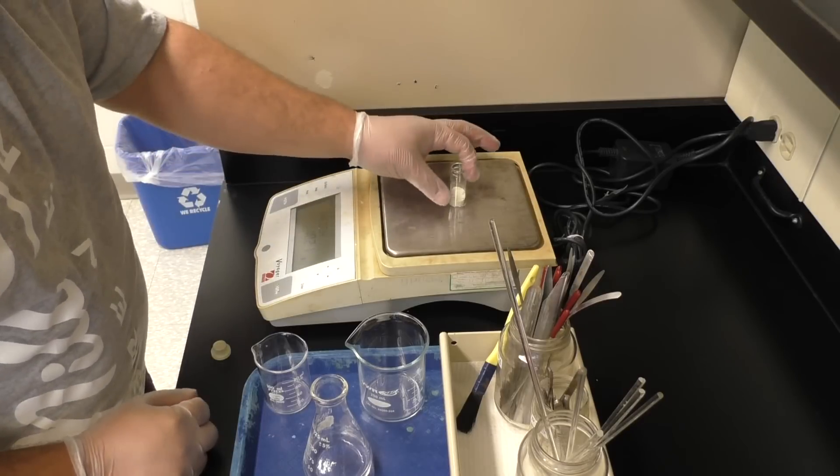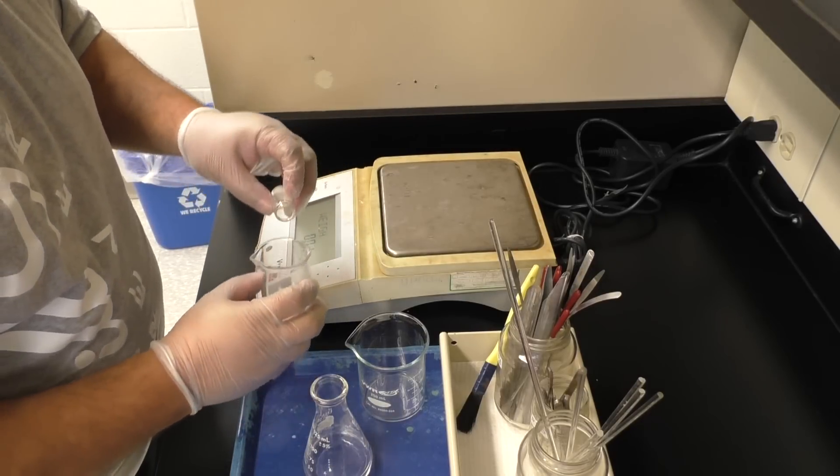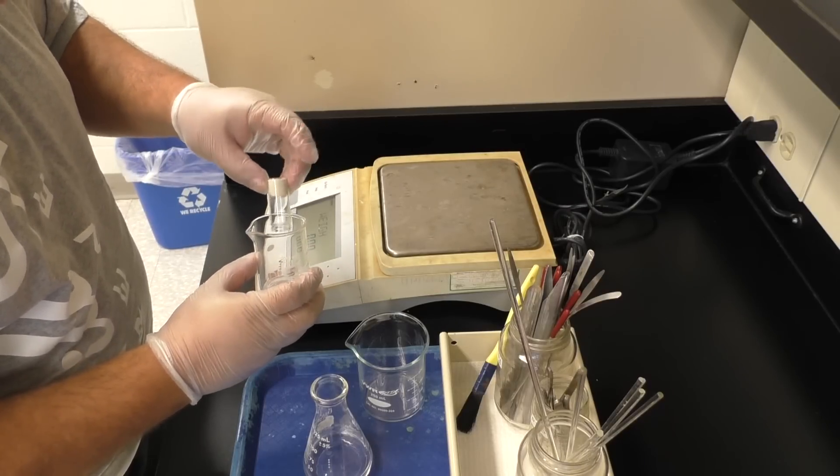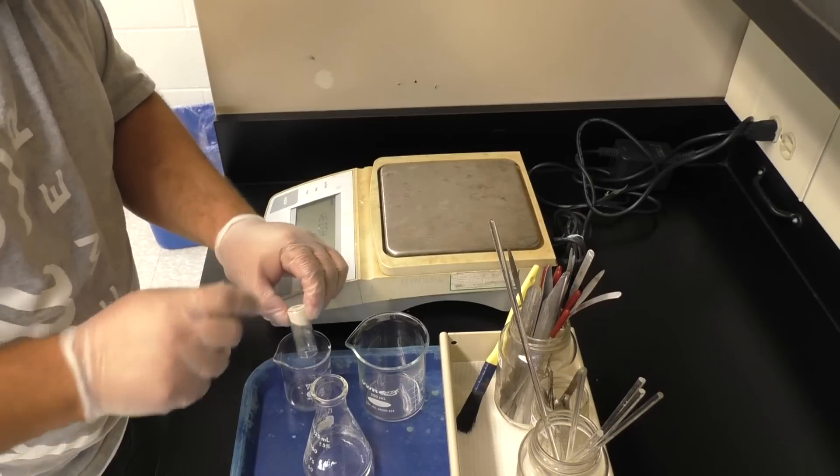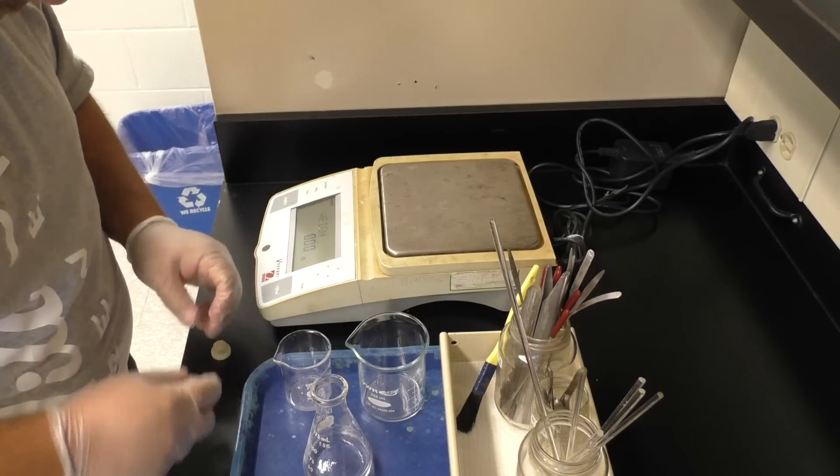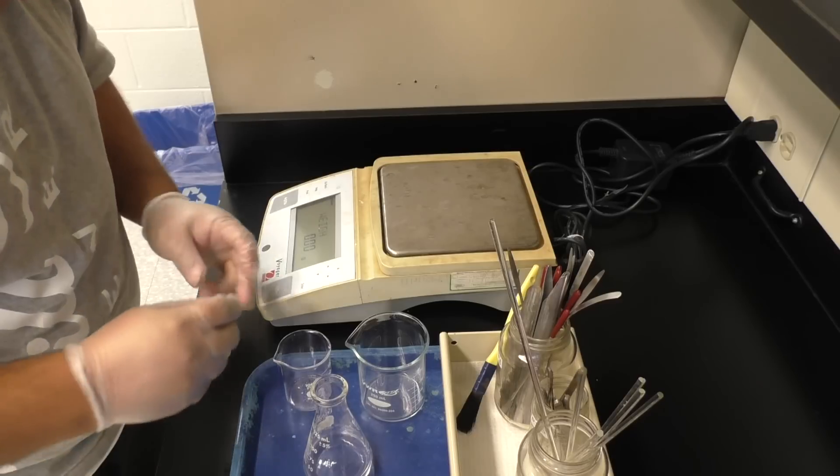Then you're going to transfer it into a beaker, and depending on how long it's sat there on the shelf, it may not come out initially, so give it a little bit of a tap. If that doesn't do it, you can just try banging on the side of the bench, and that should take care of it.